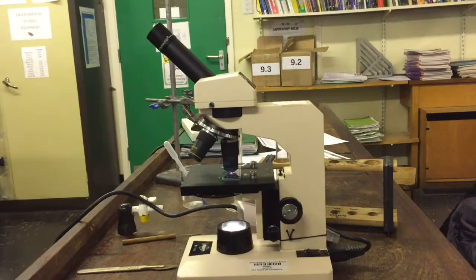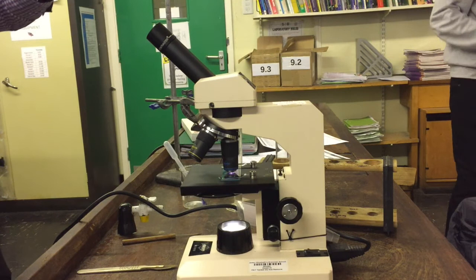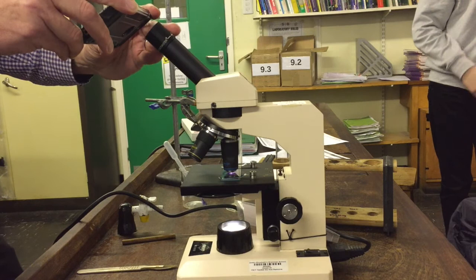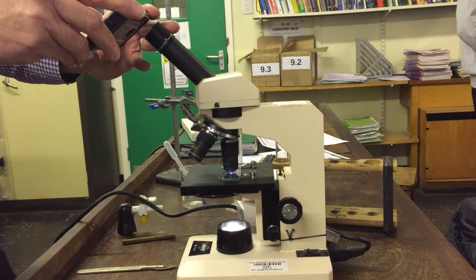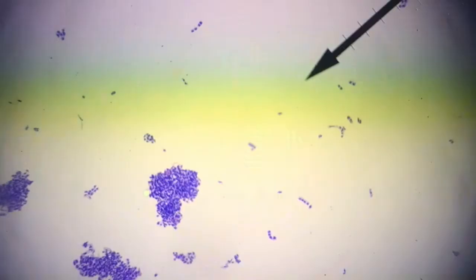If you've got a smartphone with a camera, which most of you have, it's actually really easy to take pictures. The way to do it is you take one hand like this and rest it against the side of the microscope to give yourself some stability. Because otherwise it wobbles around. Slowly point towards it and get it quite close. It's fiddly but you can get some good results. If you find something really interesting, snap it with your camera phone and we can upload it to the Google Classroom.